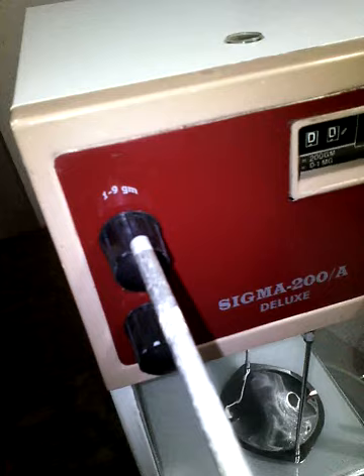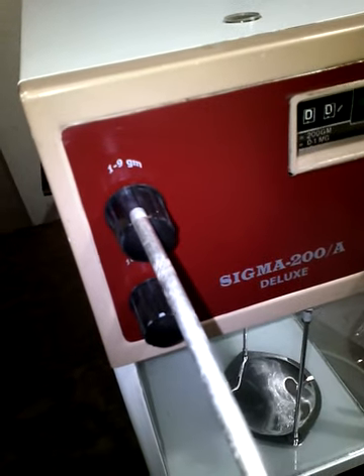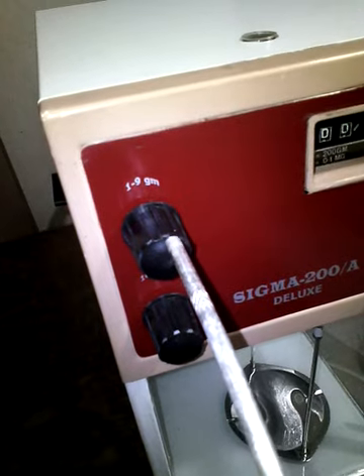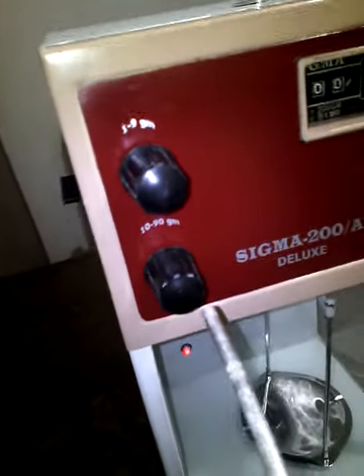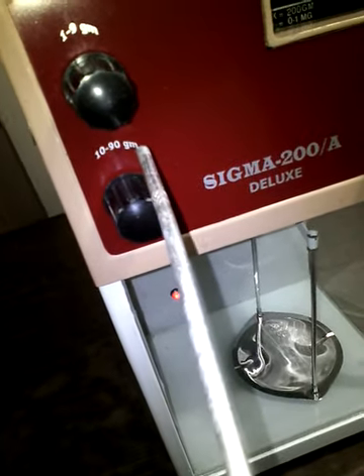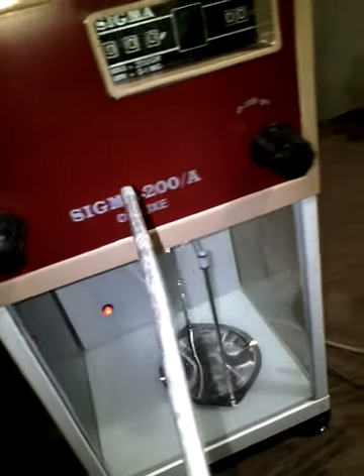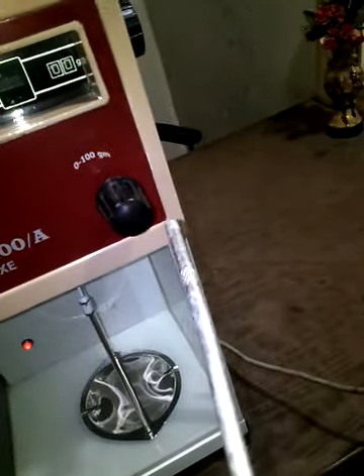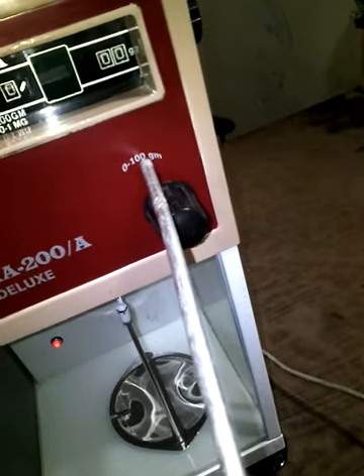At the upper side, this knob is used to weigh from 1 gram to 9 gram. The knob just below it can weigh between 10 gram to 90 gram. At the other side, there is another isolated knob which is used for weighing 100 gram material.